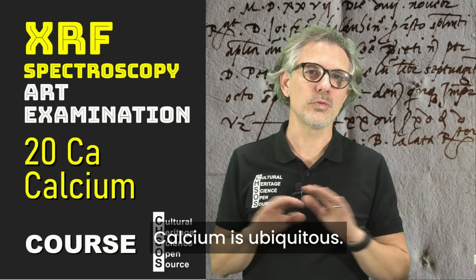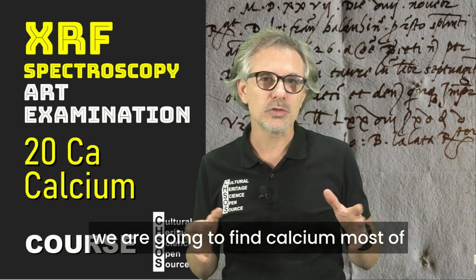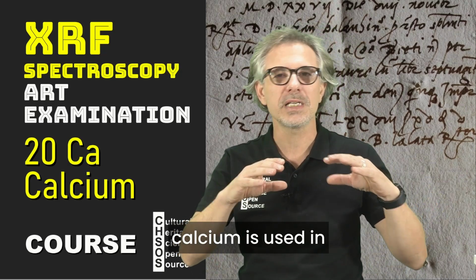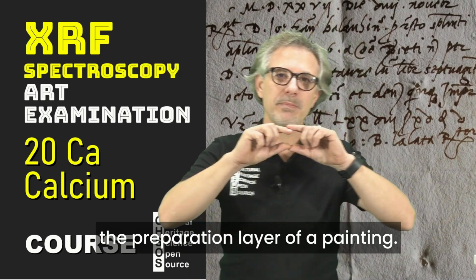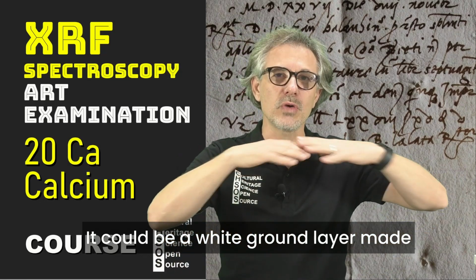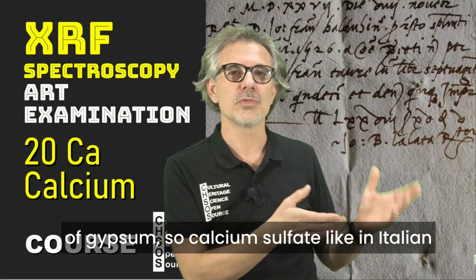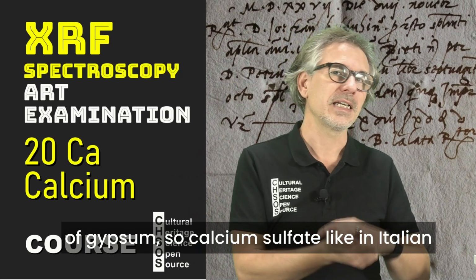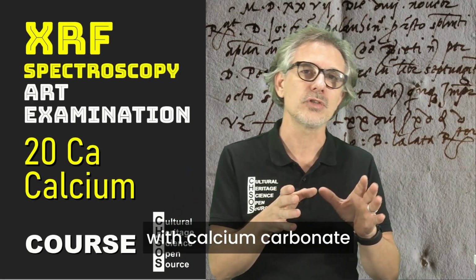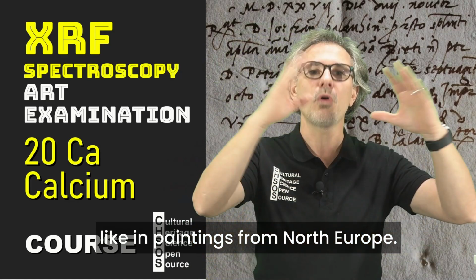Calcium is ubiquitous. In the analysis of pigments, we are going to find calcium most of the time because calcium is used in the preparation layer of a painting. It could be a white ground layer made of gypsum, so calcium sulfate, like in Italian Renaissance, or it could be made with calcium carbonate, like in paintings from North Europe.